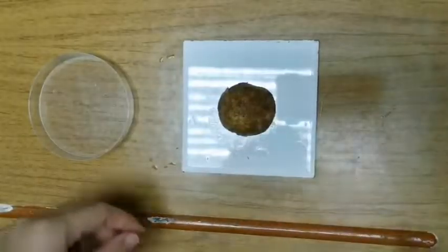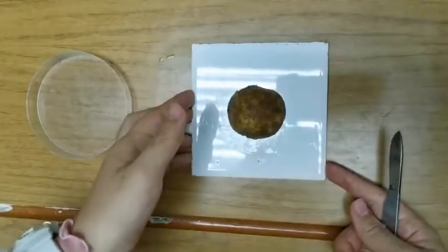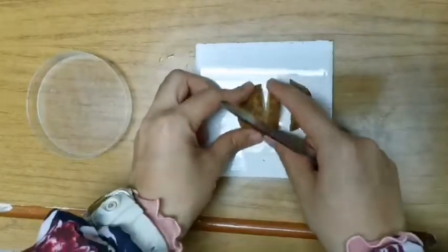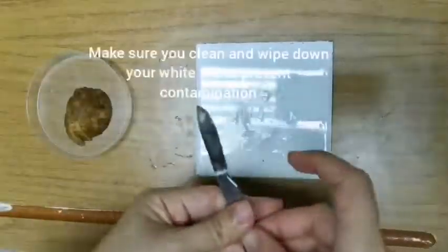Here we have a piece of potato, and if I'm asked to test 4 different food tests, then I just chop it into equal pieces here. I've already cut it up. I'll put it into a petri dish on the side.